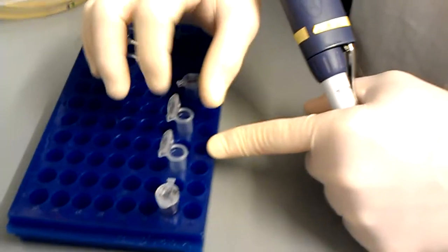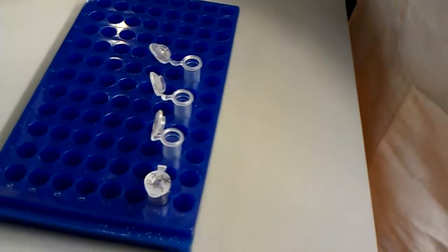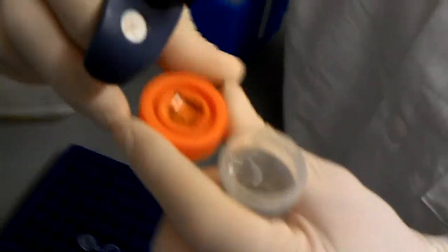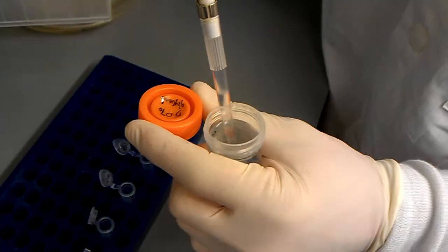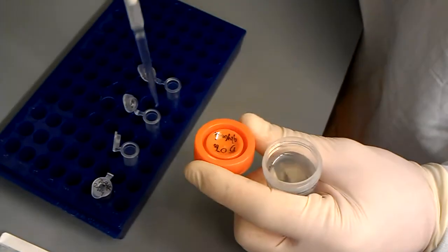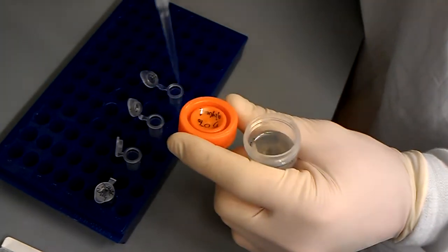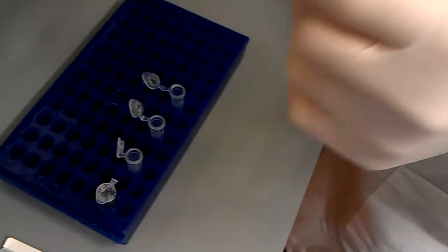Get my tip. Get my glycerol. Open my glycerol. So, pull up 750 and then just dispense 750 into all three. So we're kind of saving on consumables. And then I can reuse that tip for some culture.